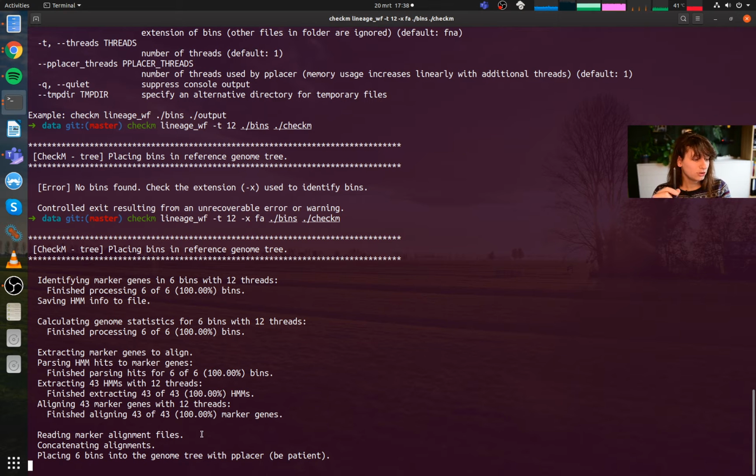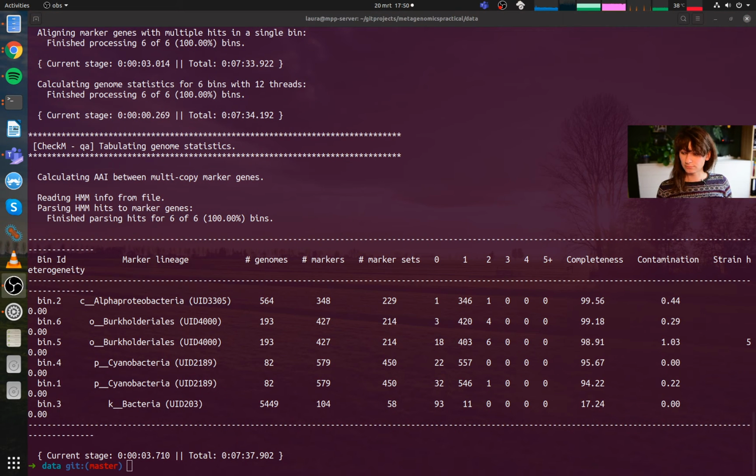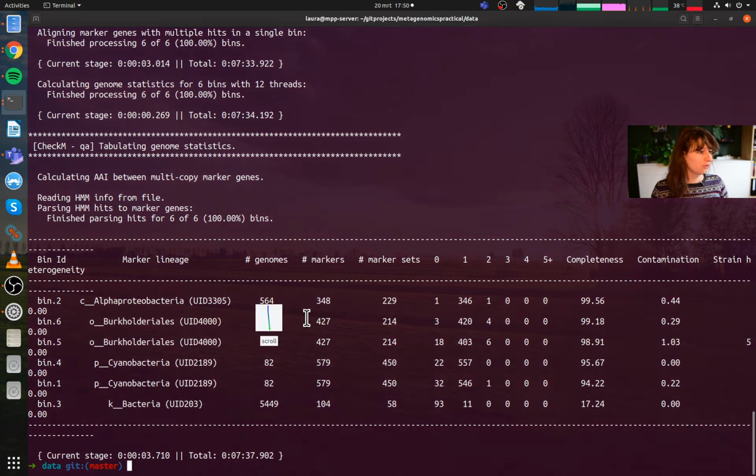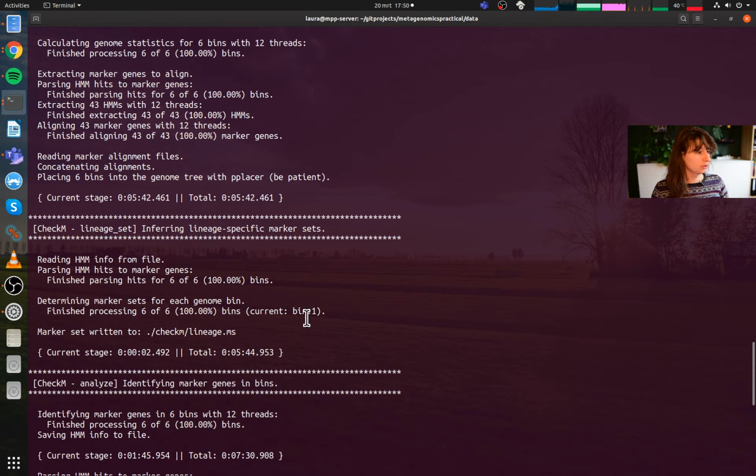So these calculations will take a bit. So I'll be back in a second and we'll look at the results. Okay, there we are. Calculations are finished. So what did it do?